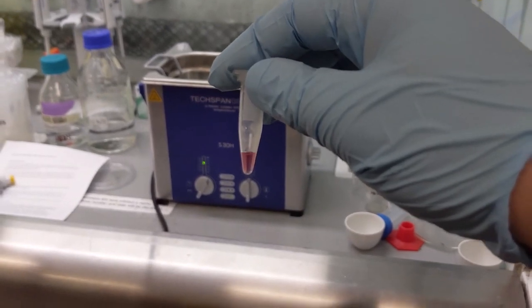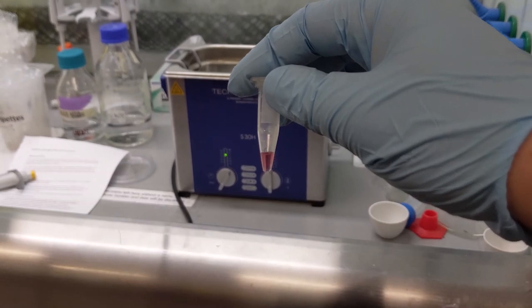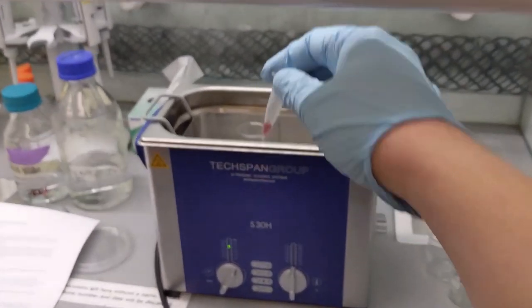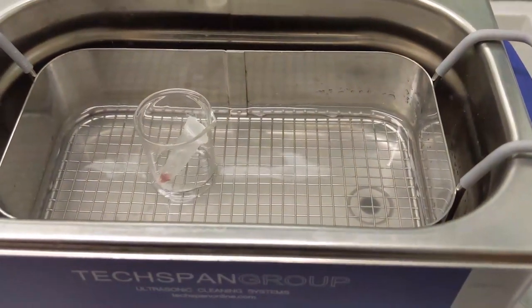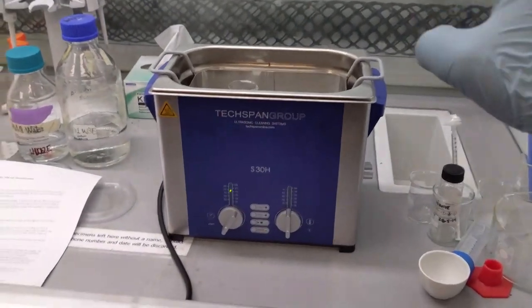At the end of this we should have broken up any clumps of nanoparticles that may have formed, and we will end up with a solution we can drop cast onto the TEM grid. So we'll put that in, press play, and we can see that. This will take 15 minutes so we'll come back later.